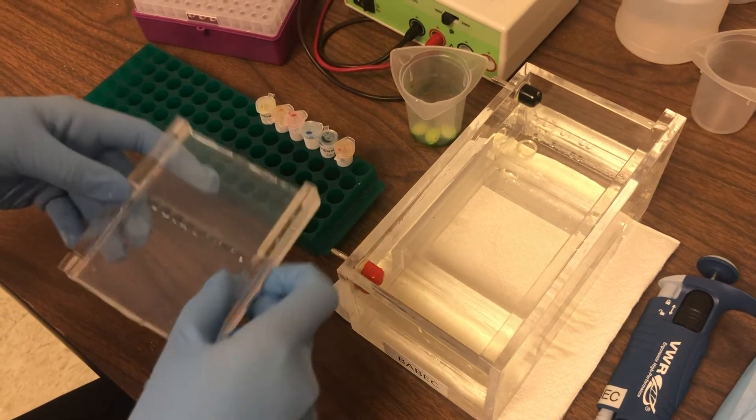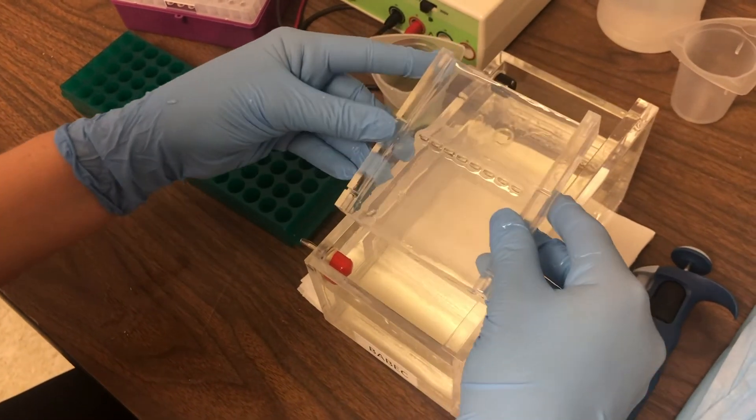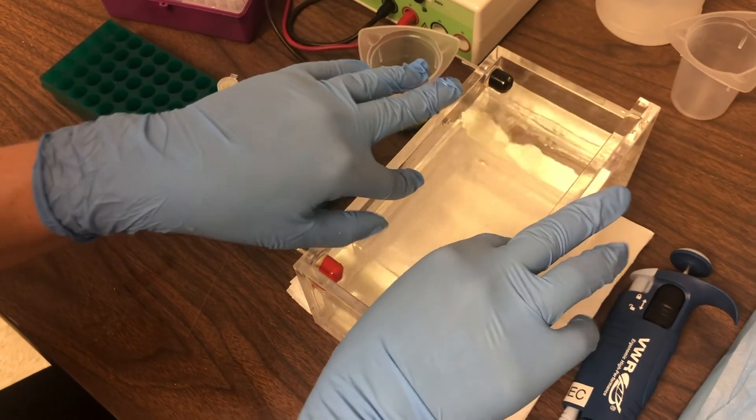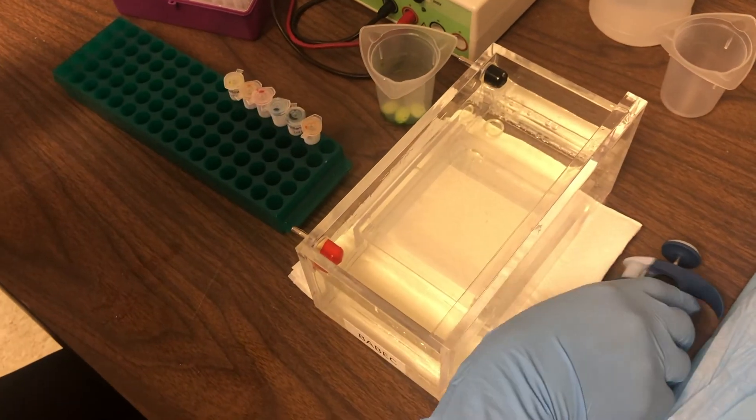So let's get ready to do our gel electrophoresis. First, we'll add our agarose gel to the gel box. You'll see the box is full of TAE buffer.